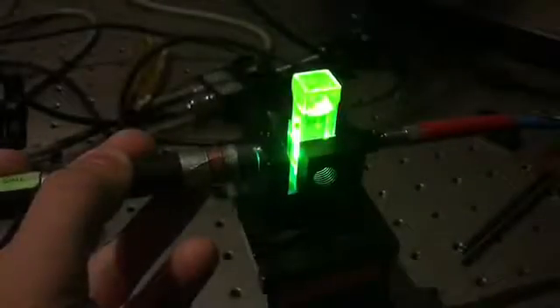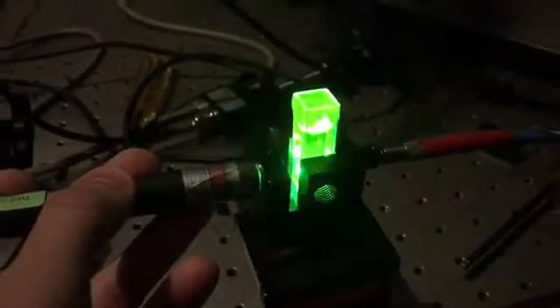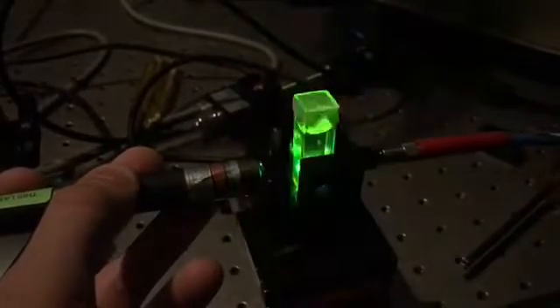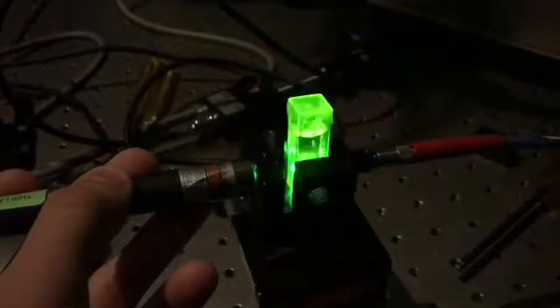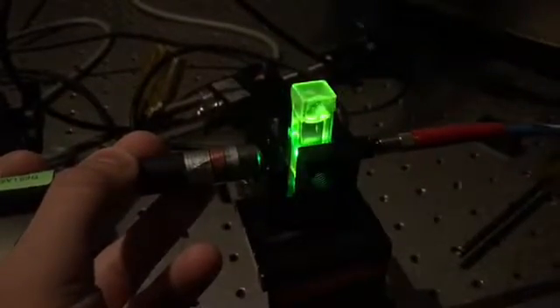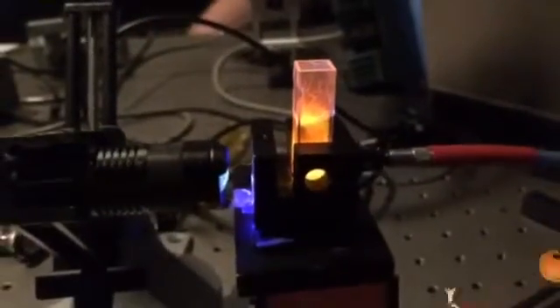Two important concepts of this lab are fluorescence and phosphorescence. Fluorescence is the property of some atoms and molecules to absorb light at a particular wavelength and to subsequently emit light of longer wavelength after a brief interval, termed the fluorescence lifetime. The process of phosphorescence occurs in a manner similar to fluorescence, however, there is a much longer excited state lifetime.